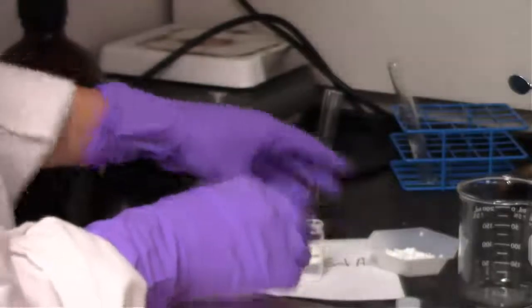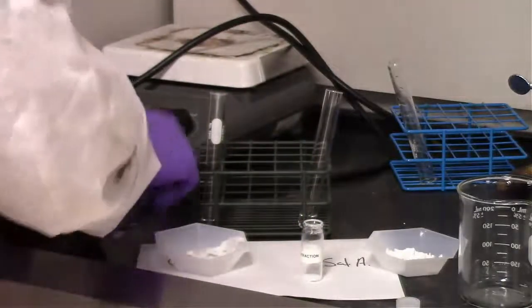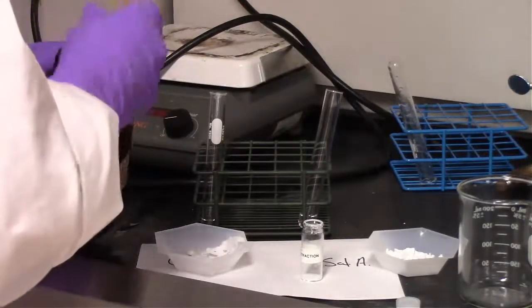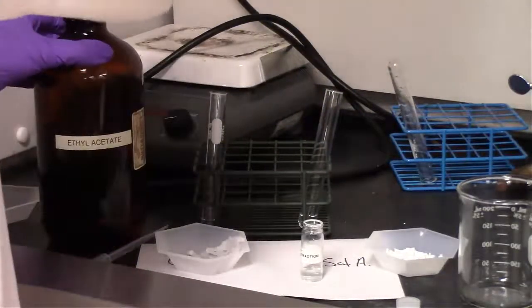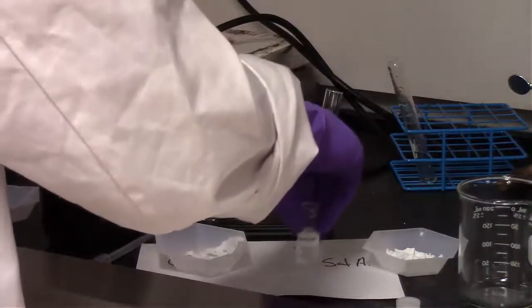Alright, so this is the original vial that we took, so that had our 1-to-1 mixture of caffeine and salicylic acid in it. We're just going to add some solvent directly to that. It looks like the amount of solid in that is substantially more than the tips that we added, so I think if we add a small amount of solvent to that and we dissolve all that compound, that's probably a good amount to spot. So I would guess we're probably going to see that spot on the plate when we spot it.